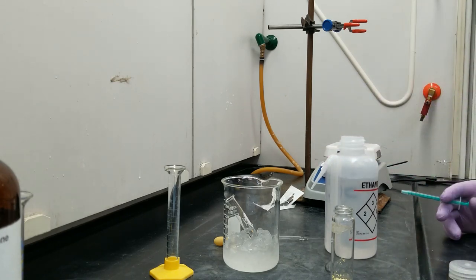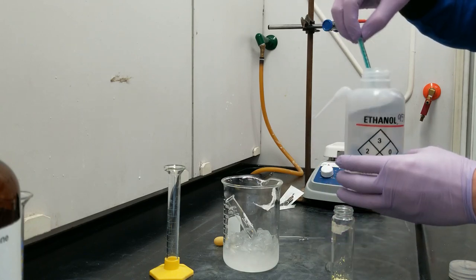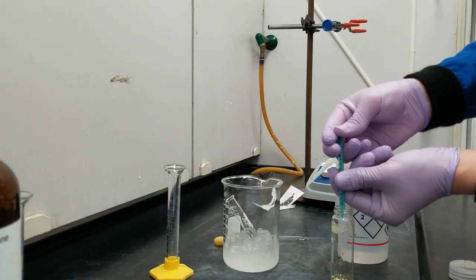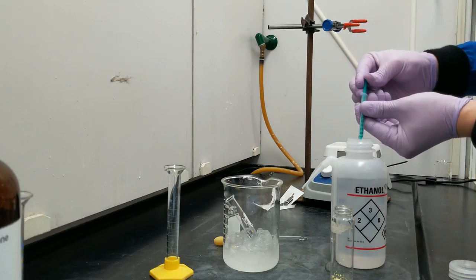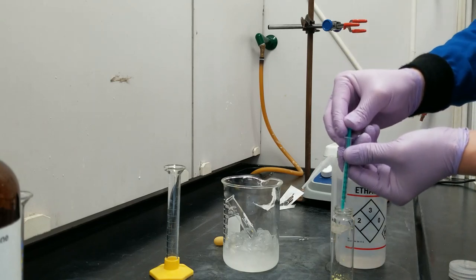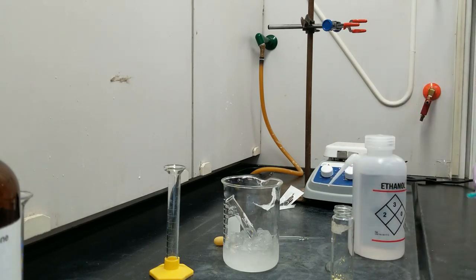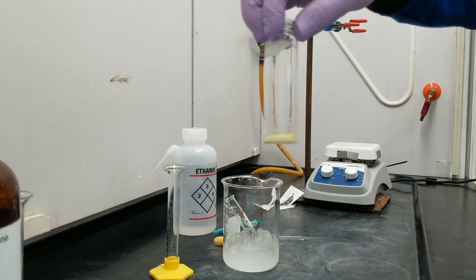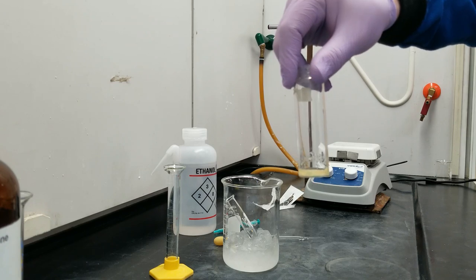The amount of ethanol I need is approximately 1.1 milliliters — at least that's the best I can measure with the tools available. I'm going to use a syringe for this and pull straight from the ethanol squirt bottle. The solid is not dissolving at all in the ethanol at room temperature. This amount of ethanol should only dissolve the product at full reflux temperatures.